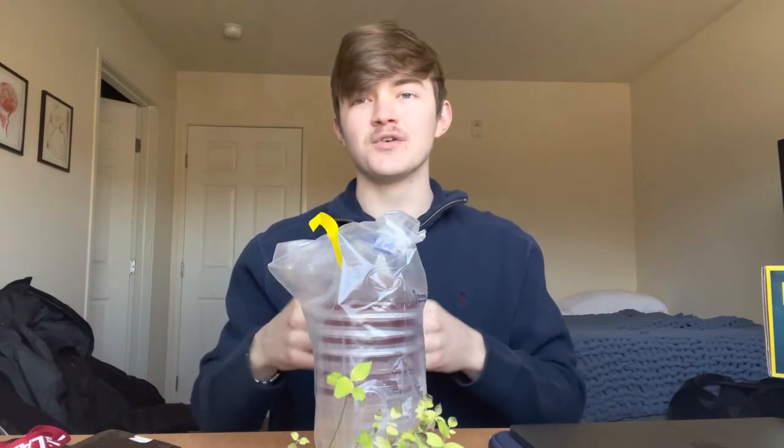So now is the time — we're going to take these swabs and swab things like a door handle, a phone, a computer, laptop, the bottom of my shoe, and even a public toilet seat. The first step before we actually get swabbing is taking out these petri dishes, setting them out, organizing them and labeling them so I know exactly what I'm putting on each one — bottom of my shoe, toilet seat, phone — so when I come back I know exactly what bacteria grew on that surface.